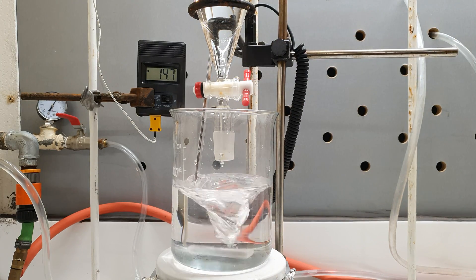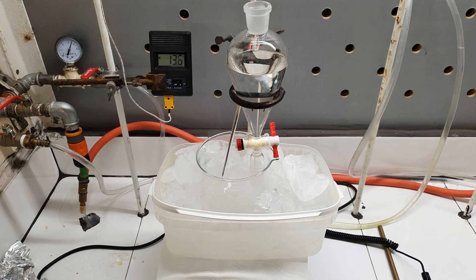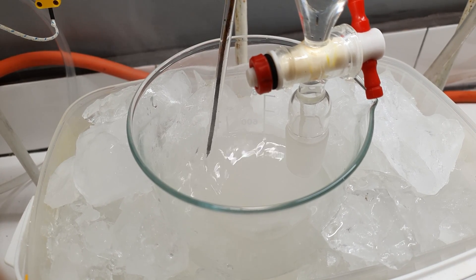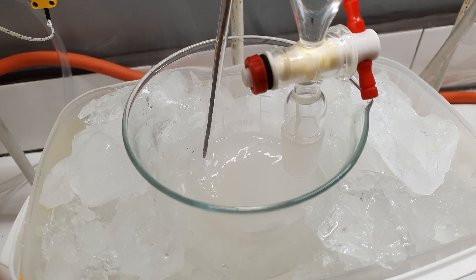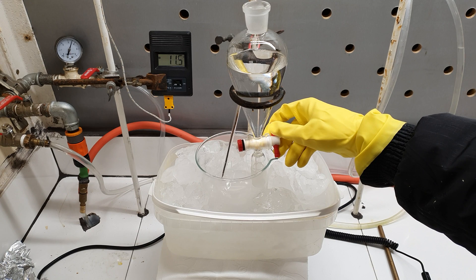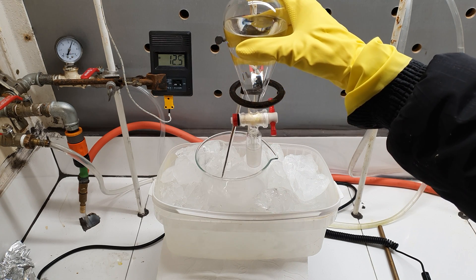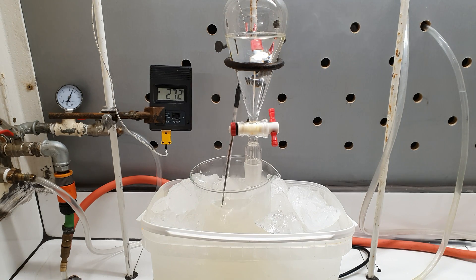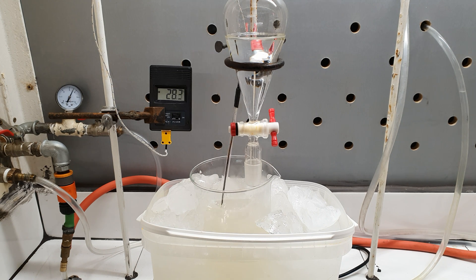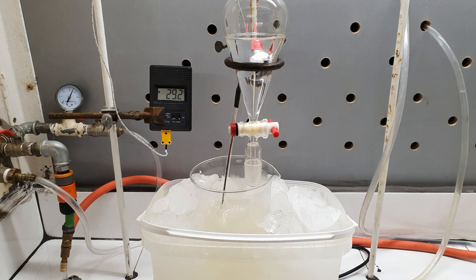Contrary to potassium bromide, the dissolution of sulfuric acid is very exothermic. To prevent the temperature from rising too much I put the beaker in an ice bath. By adding sulfuric acid to the bromide we convert it to hydrobromic acid, which is needed to brominate the alcohol later. The vapors you see are mostly hydrogen bromide, because this acid, just like hydrochloric acid, likes to fume. If the temperature goes too high, the sulfuric acid will oxidize the bromide, turning it into bromine — we don't want that, and that's why I use an ice bath.